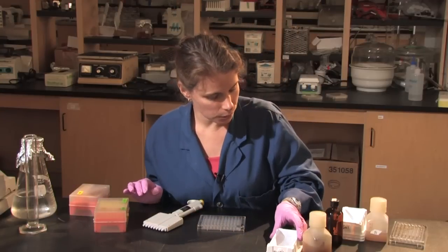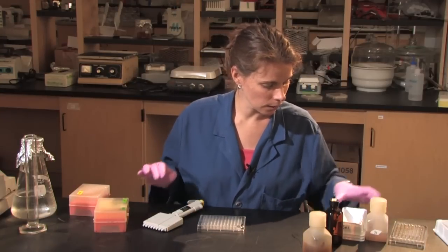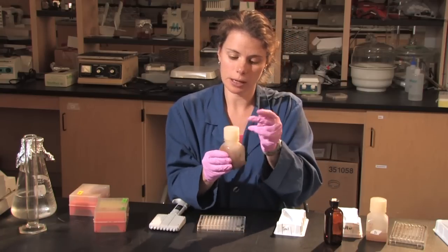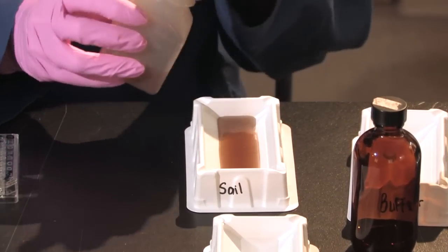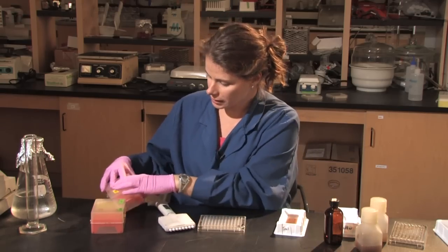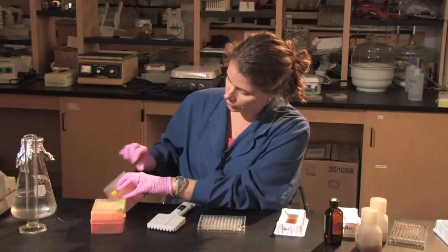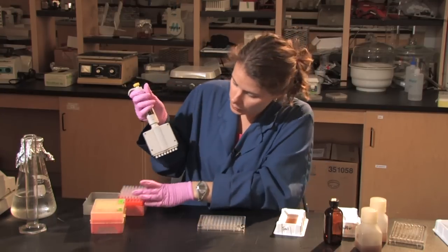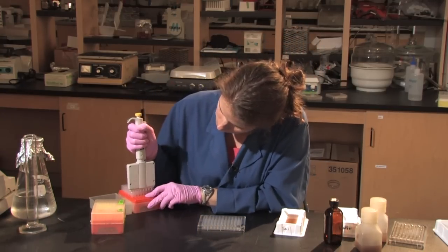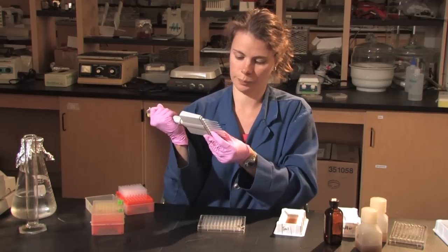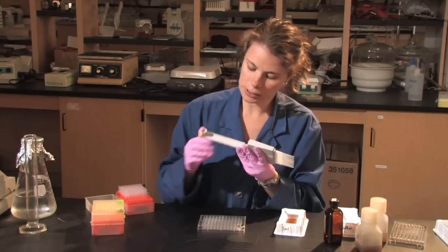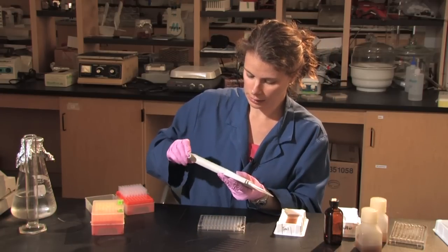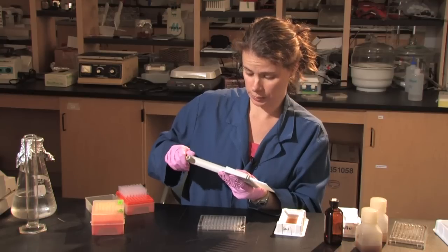The next row that I will be using will be the soil. So I'm going to take my soil that I've prepared. Again, put it into the trough. And I'll be using a wide mouth tip for this so that I can get up some of the soil particles within the solution.